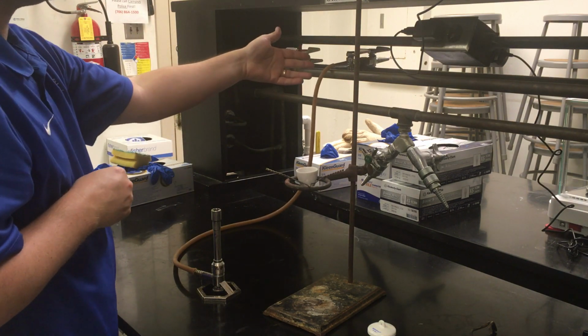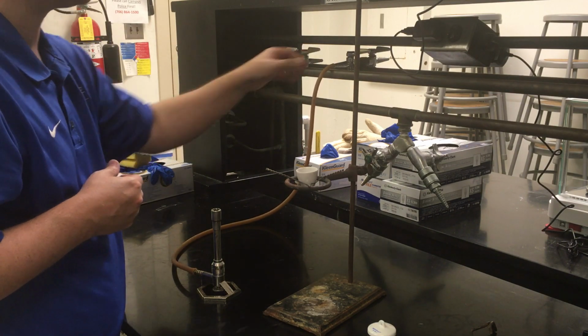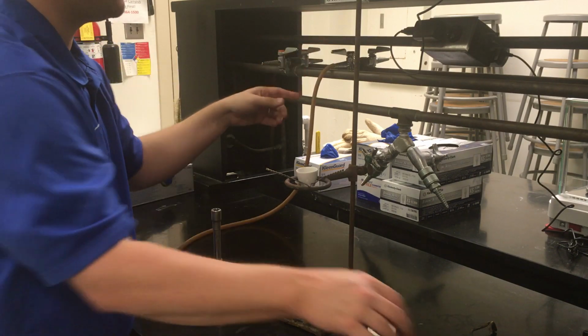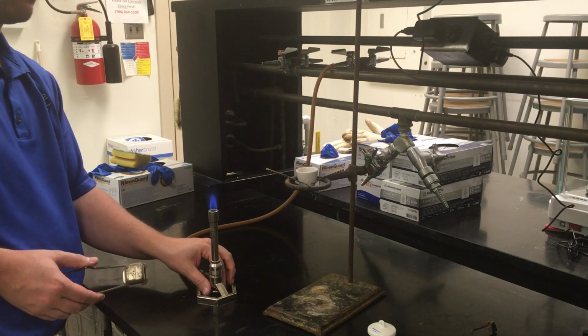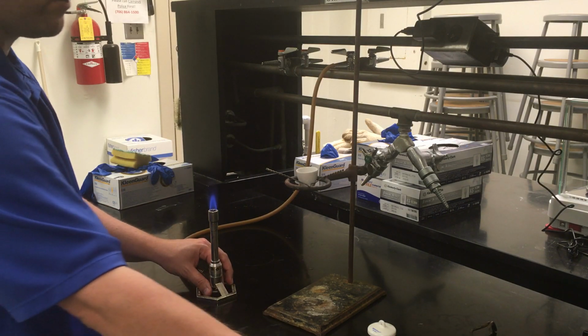And once you've connected your hose to the actual spigot on your gas valve, to turn it on, you're just going to turn the knob so it's in line with the spigot itself. You should hear a slight hissing and probably even smell a little bit of the gas coming off. If you put your striker down right over the top of it, you should get it to light right away.